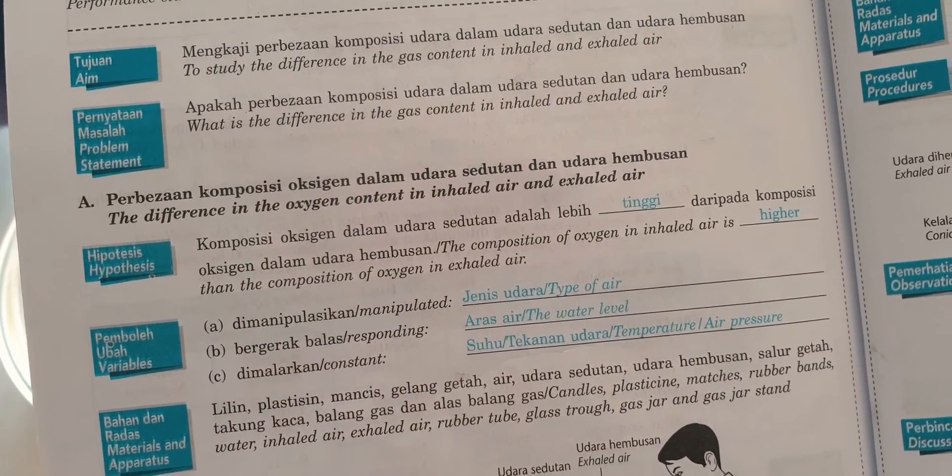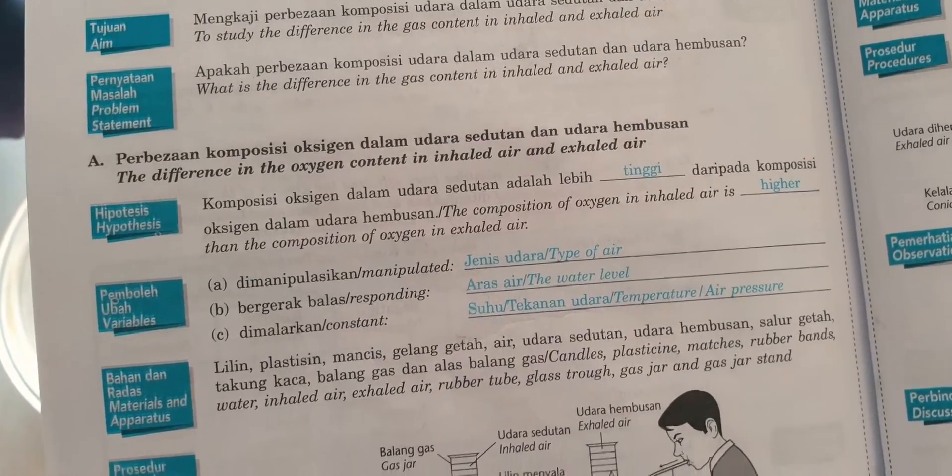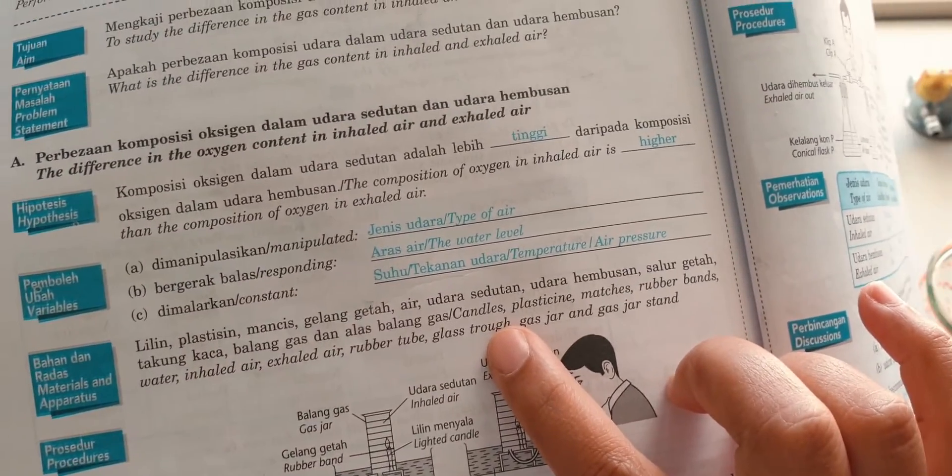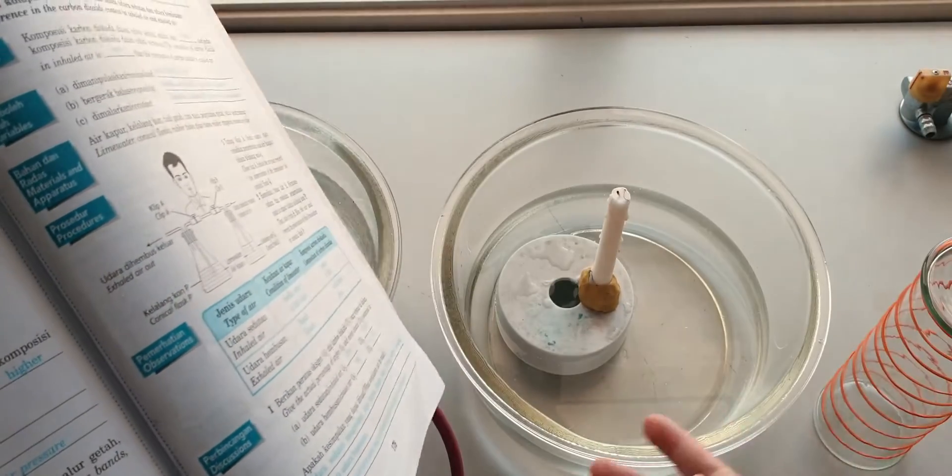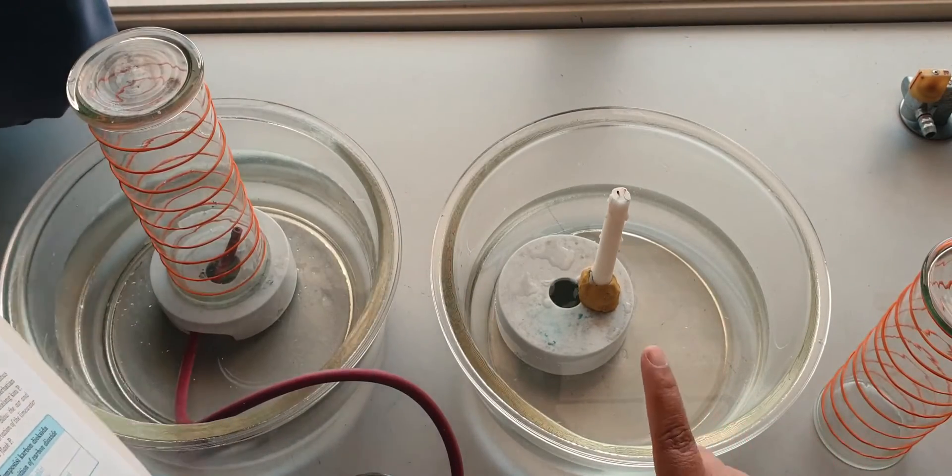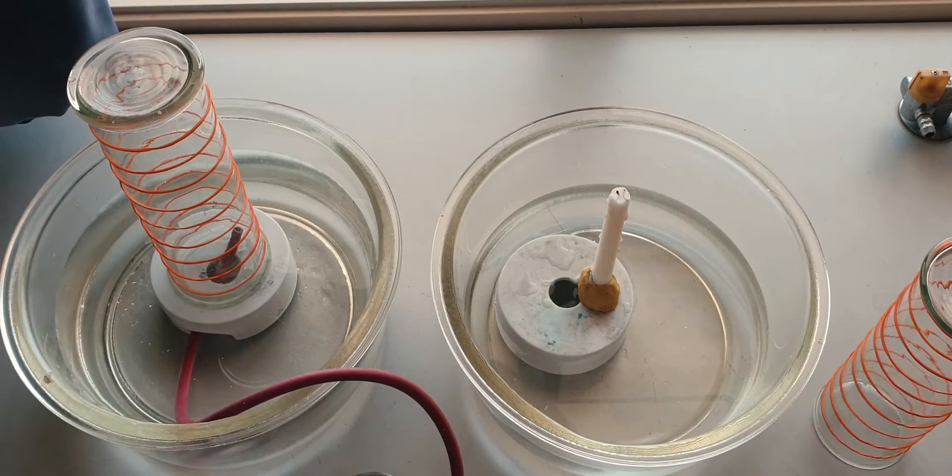What you need in this experiment are candles, plasticine, matches, so you all have it here. You have the candle over here, the plasticine, some matches.